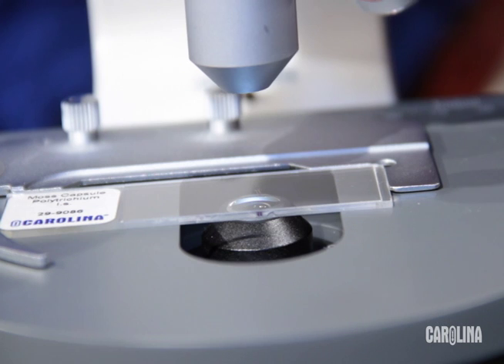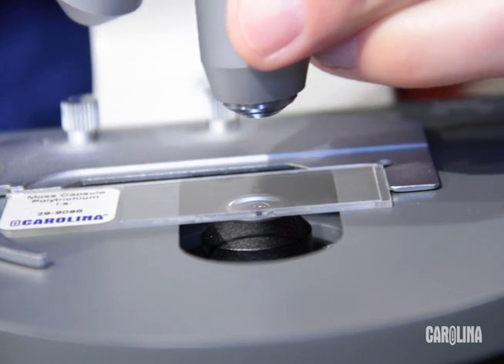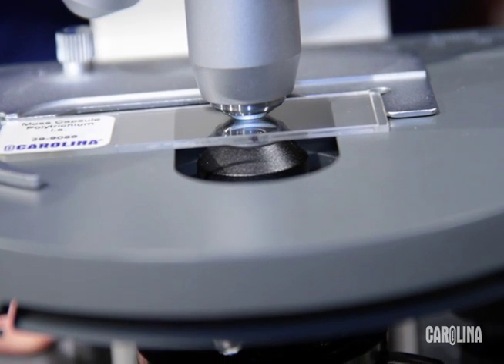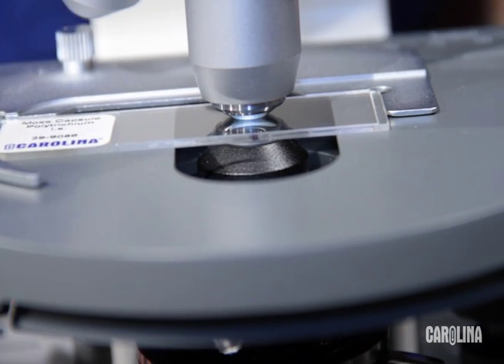However be sure to use caution with the high power objectives when focusing. The objective will come very close in contact with the specimen and could break the glass slide or damage the objective lens.